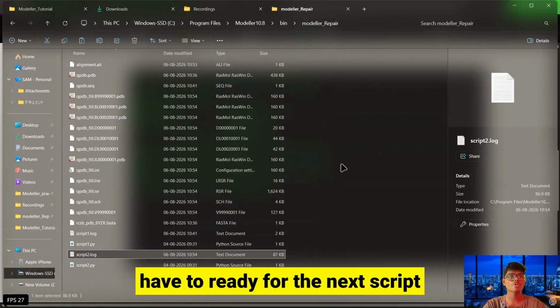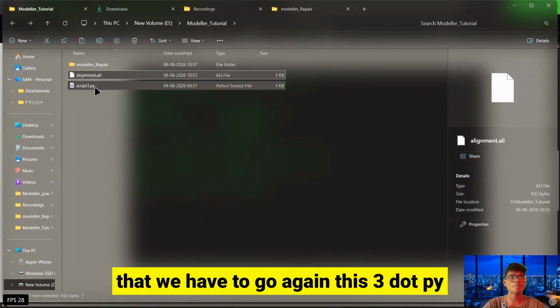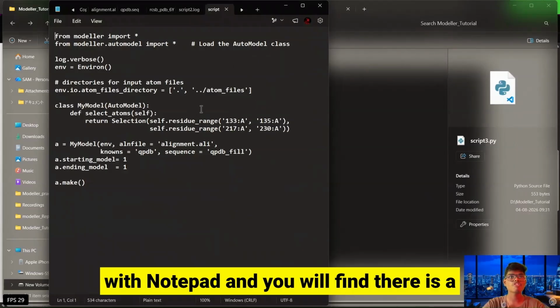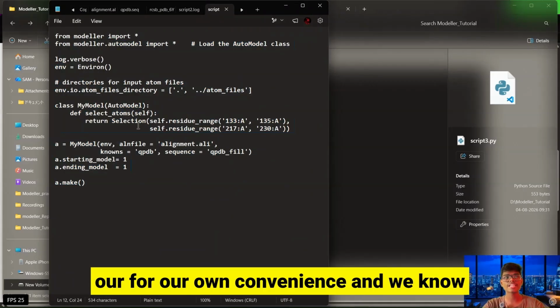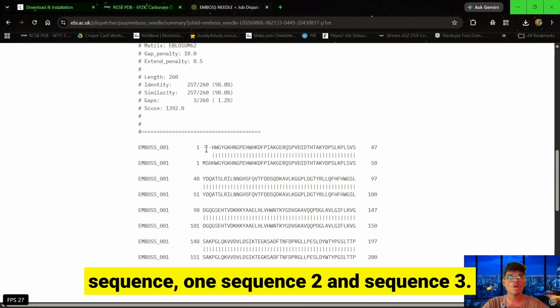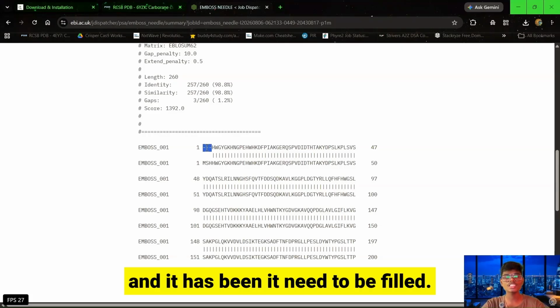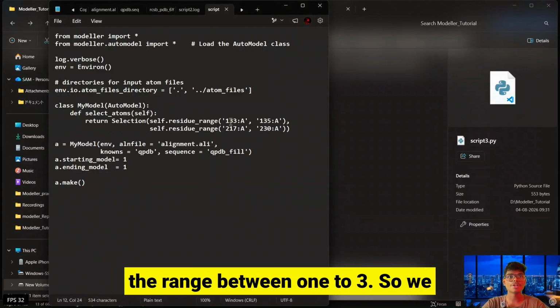So now we are ready for the next script, that is script3.py. For that we have to go to script3.py again, and we have to make some appropriate changes over here. We have to open this using Notepad only. Open with Notepad, and you will find there is different code over here, and for our own convenience, we know that we have a residue range from 1 to 3. You will find over here, like from 1, sequence 2 and sequence 3, the 3 dashes are visible. It means this much of the sequence is unknown to us, and it needs to be filled. So let's minimize, and we have to give the range between 1 to 3.